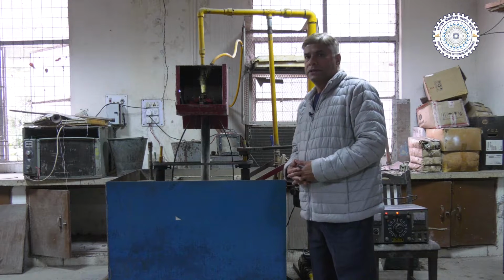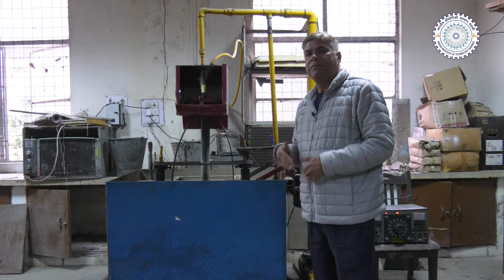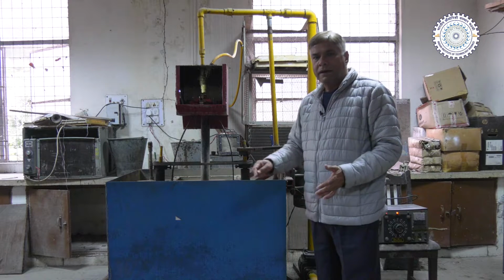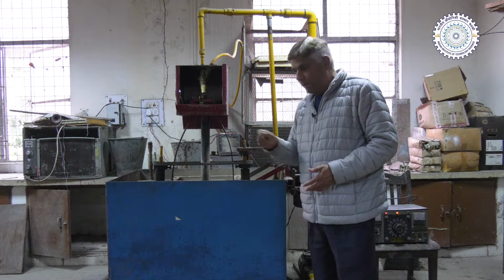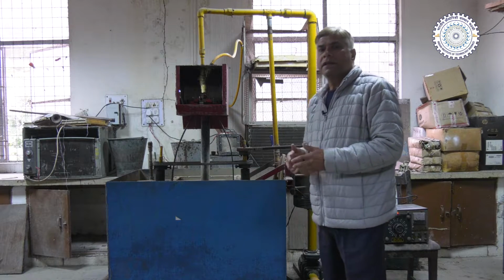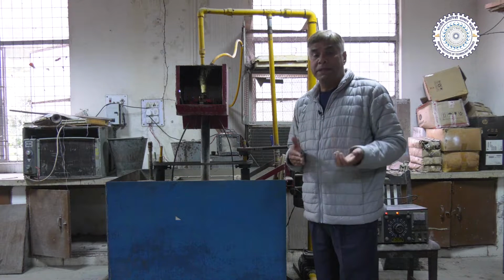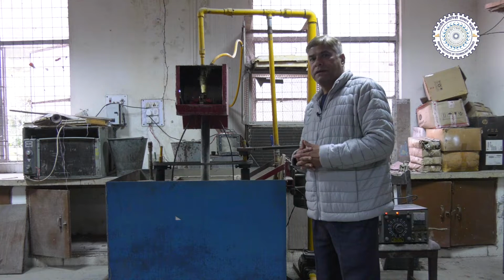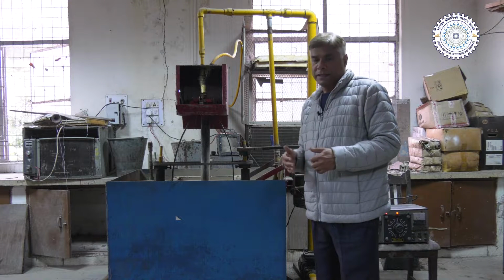has taken place. So, the slurry erosion test can be performed in number of ways. One of the simplest way is that we create a slurry in a tank, and then the sample is rotated at a particular speed, so that the slurry particles, the hard particles present in the slurry, they strike the surface and they cause the erosion. But in that case, there is no control over the speed at which these particles are impacting, or the angle at which the eroding particles in the slurry are impacting.